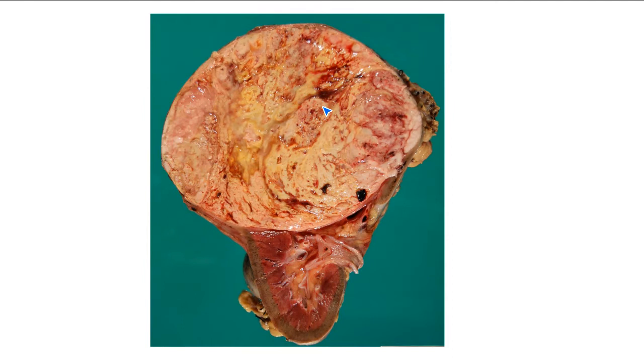Matthew, Tanya, Marshall, or Kyle, can you tell me why you think it's benign? We know that with benign tumors, the margins are well circumscribed, as shown in this lesion. That's one main characteristic of benign tumors.